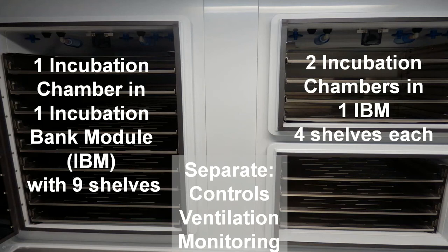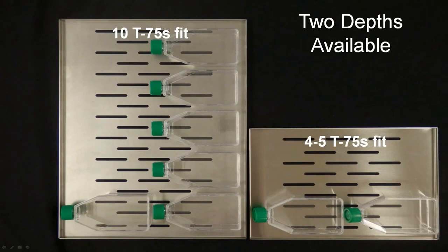Now remember, you may need room for a pan in here to provide some humidity. So while you see 9 shelves in the big incubator and 4 shelves in each of the ones on the right, you're going to want to plan for having some water dishes in there as well for humidity. Each one has separate controls, separate ventilation, separate monitoring. They can have different depths.